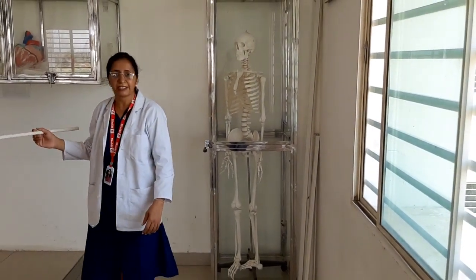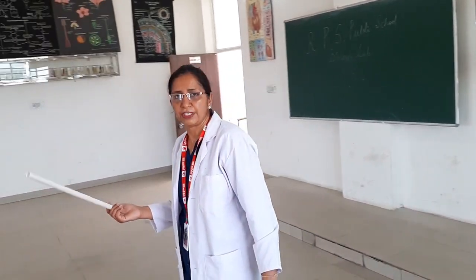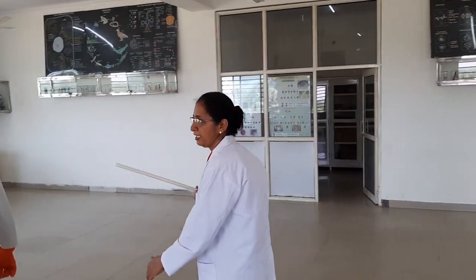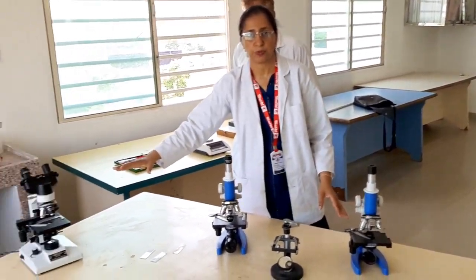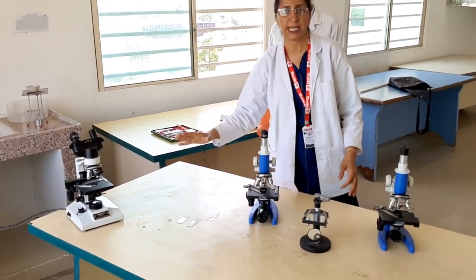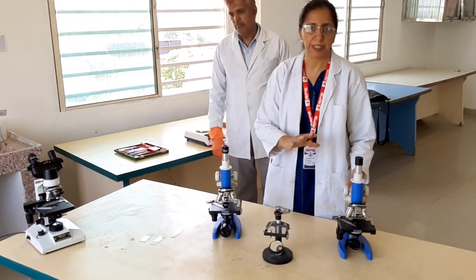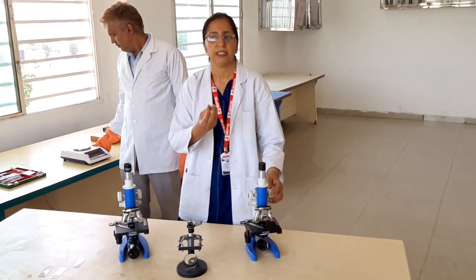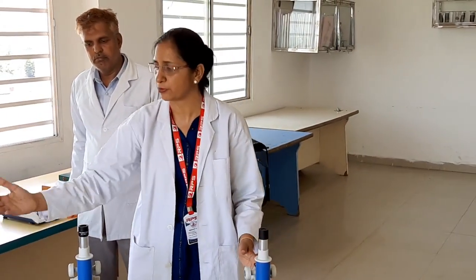These are the things present in the biology lab. Now we are coming to certain instruments and how to use them. You can see various microscopes. The microscope is the heart of the bio lab, because many microorganisms and tissues present in plants or animals are microscopic, so you can study them using a microscope.